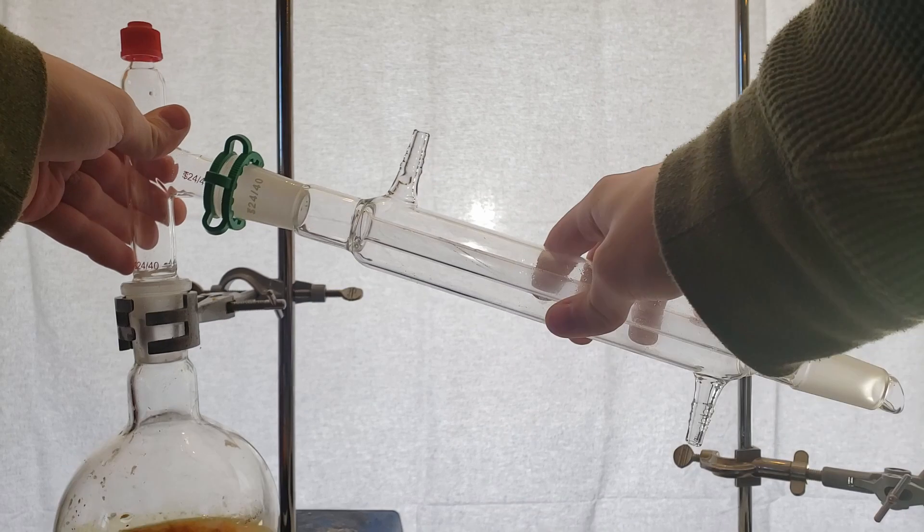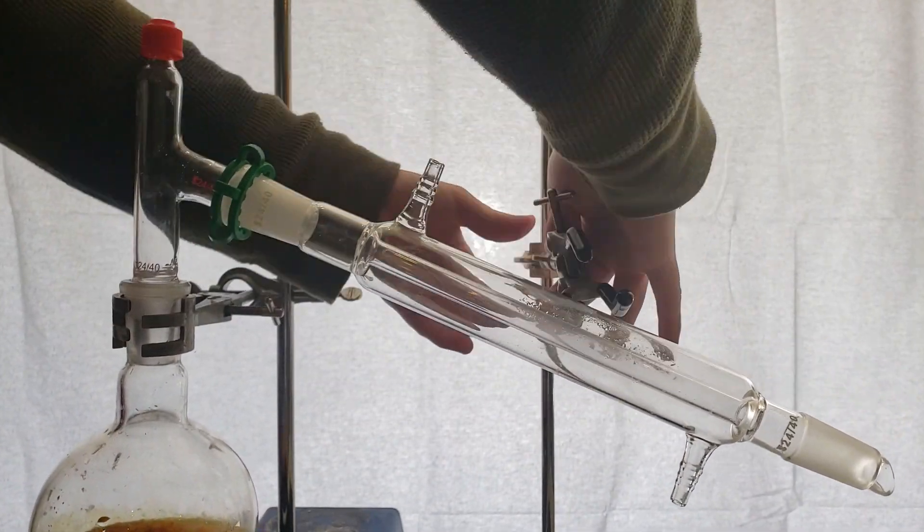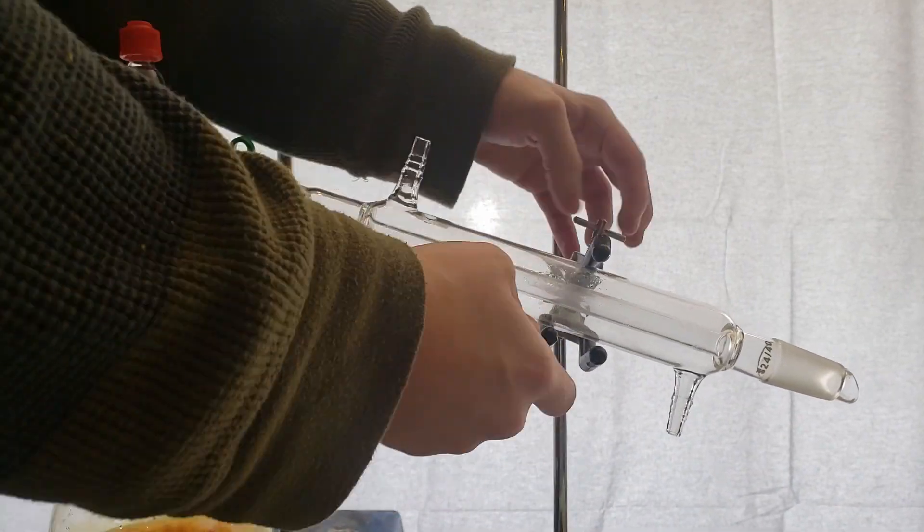Once all of the zested orange peels were in the flask, I assembled the distillation setup.